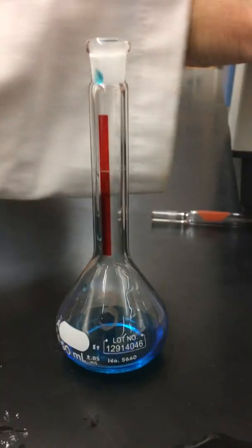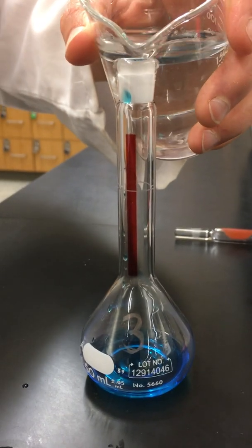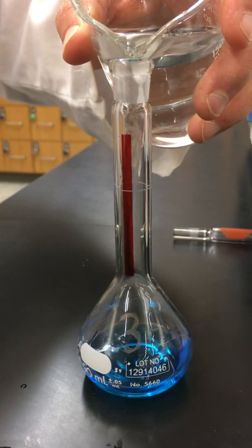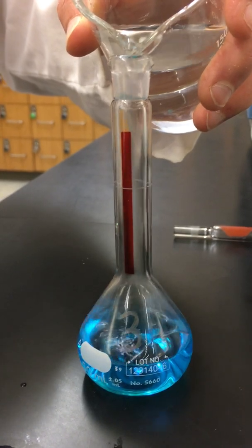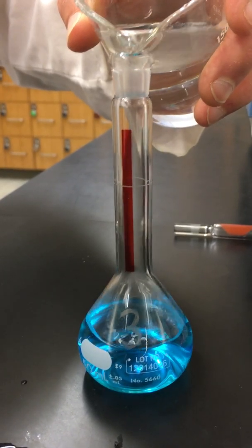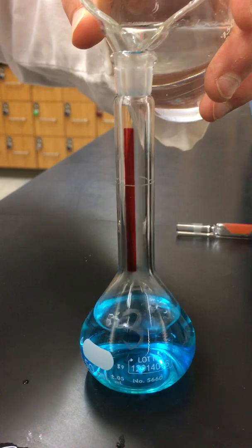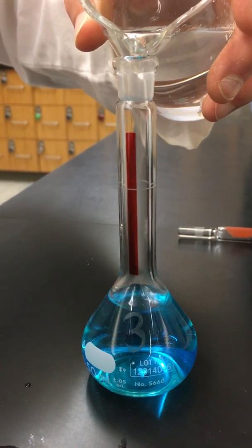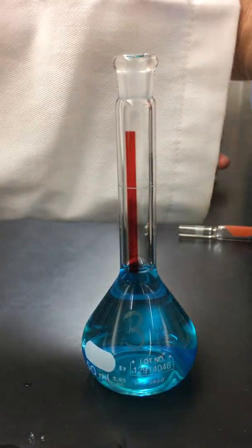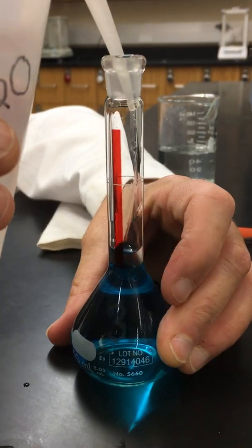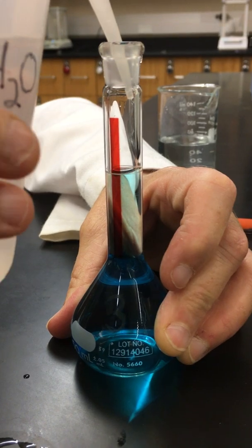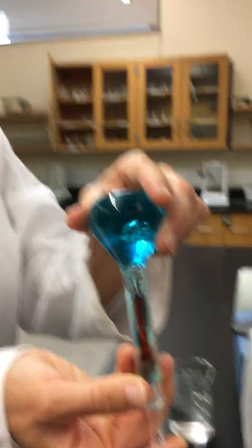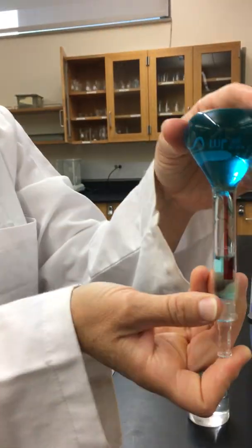And we're back. We have our third solution made. Give it a nice mix.